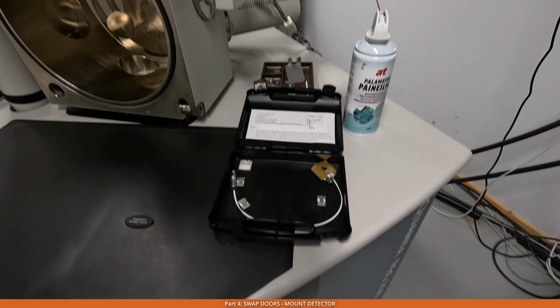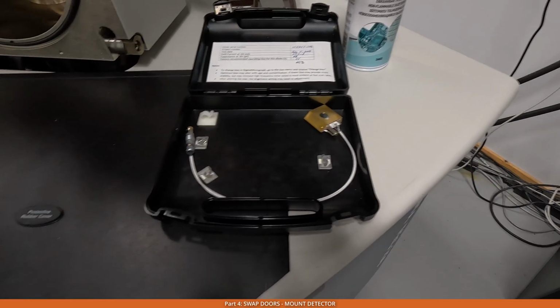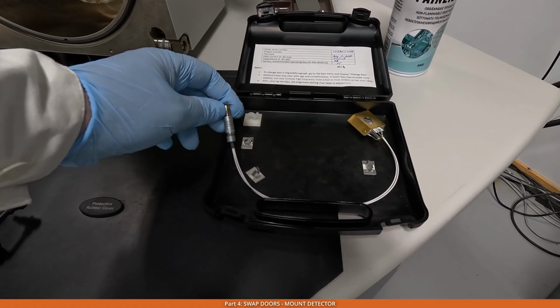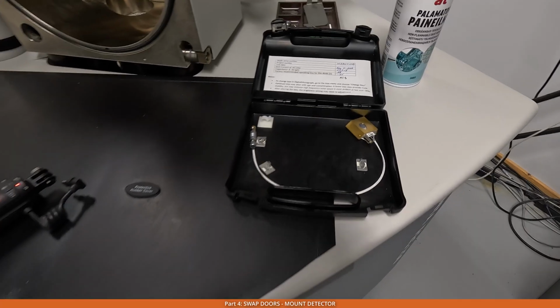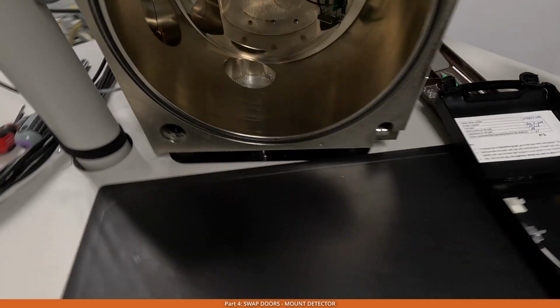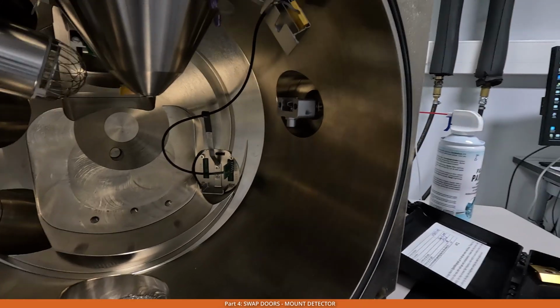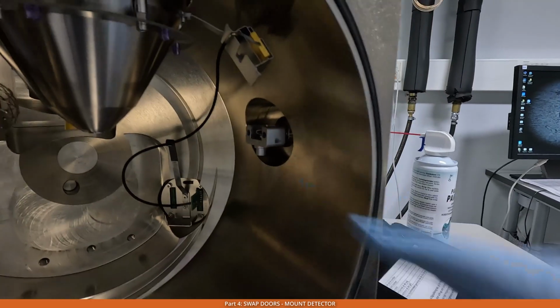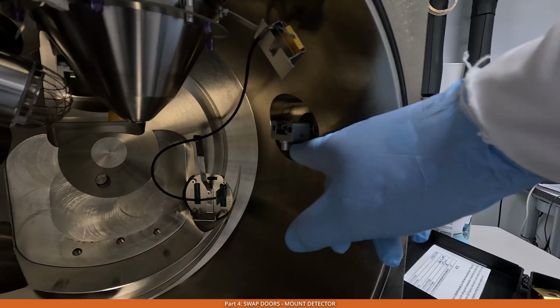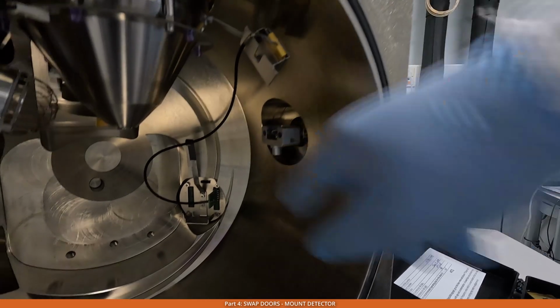When we remove the door, the next thing is to mount the detector. So here is the detector, and depending on the type of detector, there could be different slots, sockets here. This one is from the newer version, and the older version has a serial connector for computers. In our case, because we have the newer detector now, the connector is connected through this adapter. In order to connect the previous older detectors, this connector needs to be unscrewed. There are just 2 screws there.